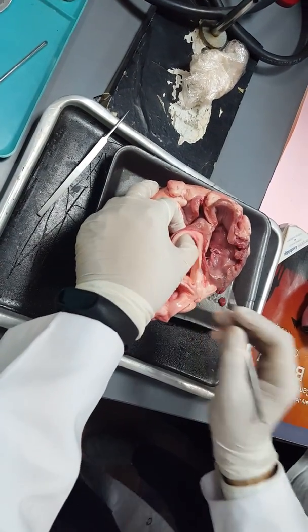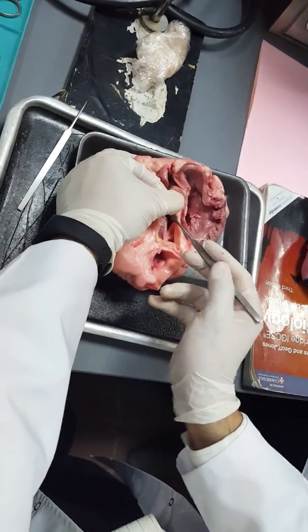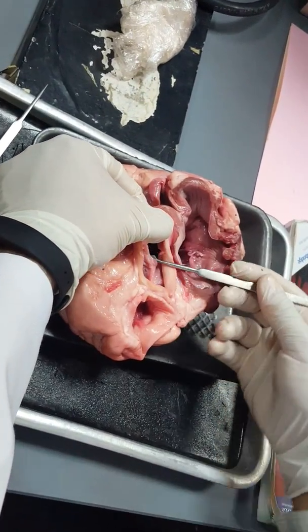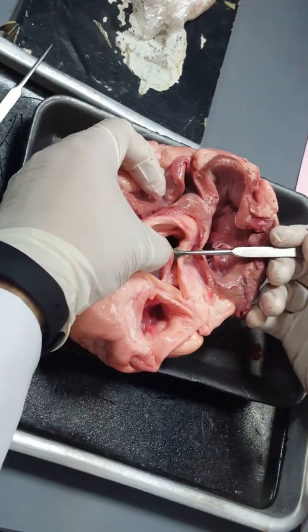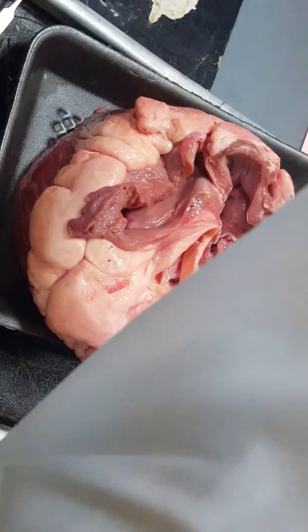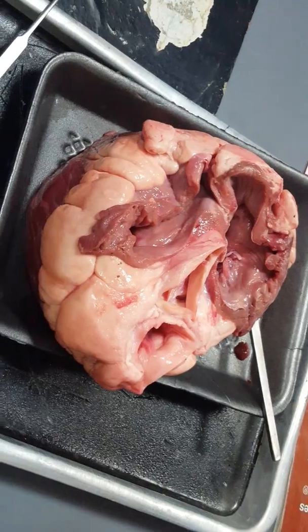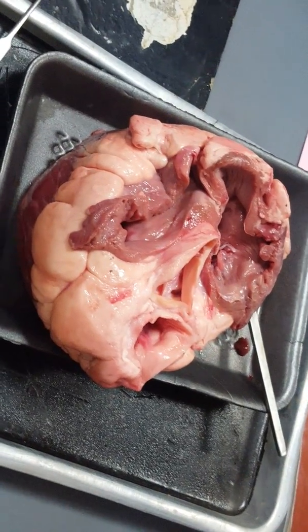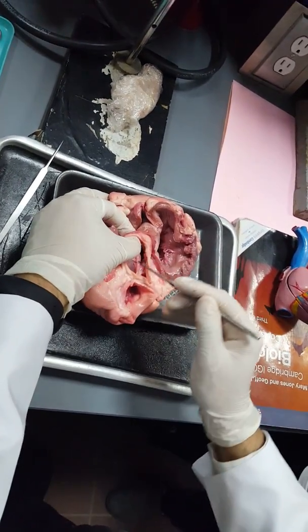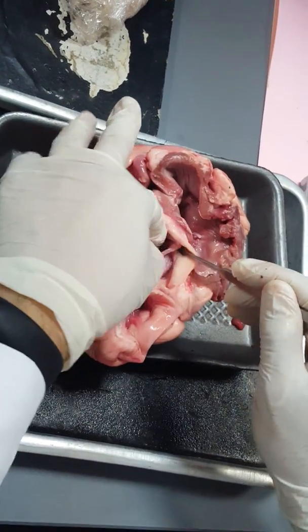Look here. The structure of the semilunar valves is totally different from the structure of the bicuspid and the tricuspid, or the atrioventricular valves. Those are the semilunar valves. Can you see them? First of all, unlike the atrioventricular valves, they are not downward, they are upward, and they make a bucket shape. They are not attached to any tendon, but they have a very unique structure. Look here, this is a bucket, and here also there is a bucket, and here there is a bucket.